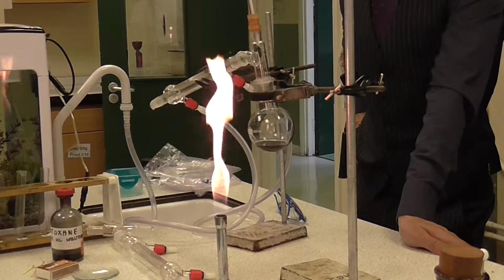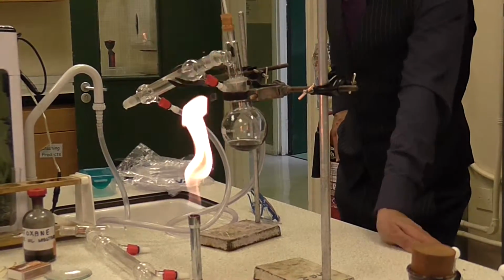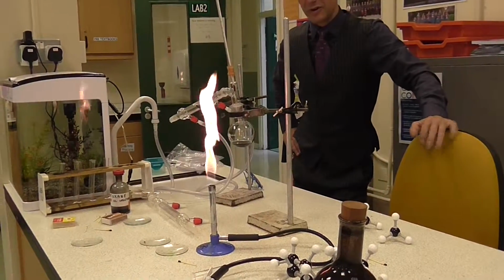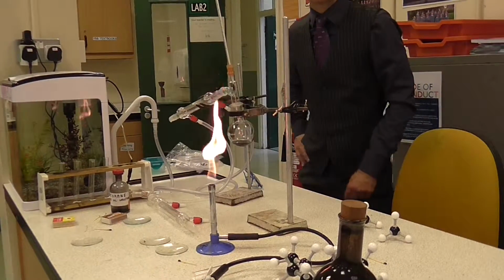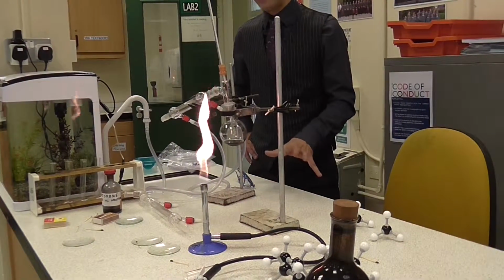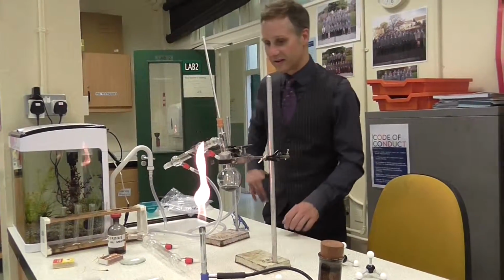You have two major problems if you're thinking about oil refining. One, it took me about 10 minutes to obtain two very, very small samples of hydrocarbon. So the equipment is just too small, we need to do it on a much larger scale. And the other problem is I had to heat it to two separate temperatures on separate occasions in order to get my two separate fractions, my two separate components, which are petrol and diesel.